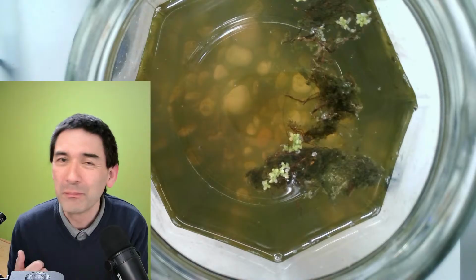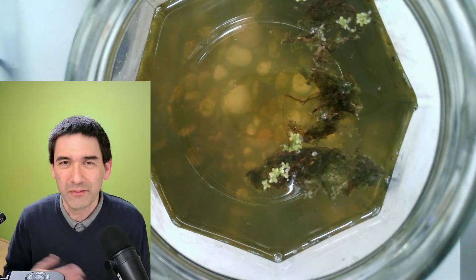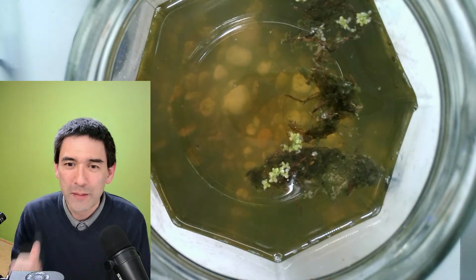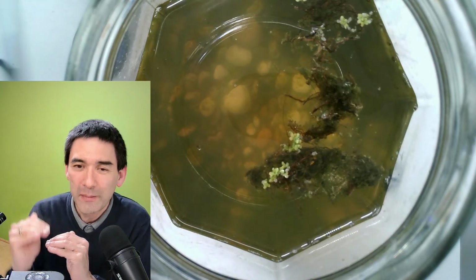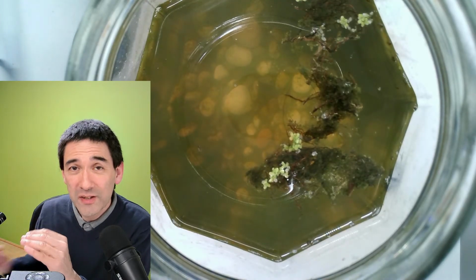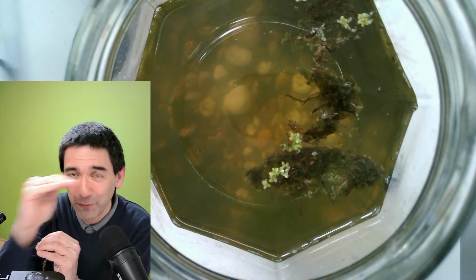Yeah, but I admit that this would probably be a huge image data file for a slide, because you don't only go two-dimensional but also three-dimensional. But that would be actually quite nice to have. So it's not just stitching in a two-dimensional way, but also in a three-dimensional way. It's not stacking. If you're stacking, you're combining the focus, but that's not what I mean. I just want to have different levels.